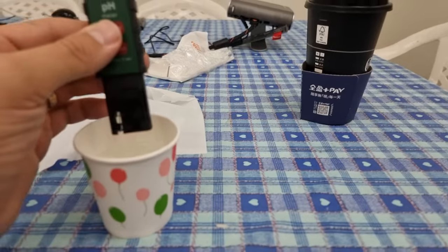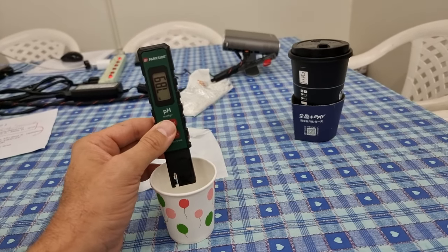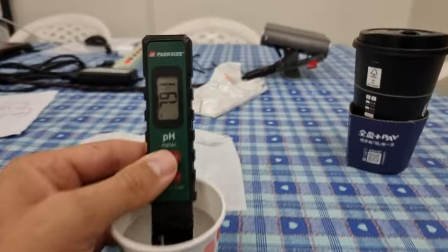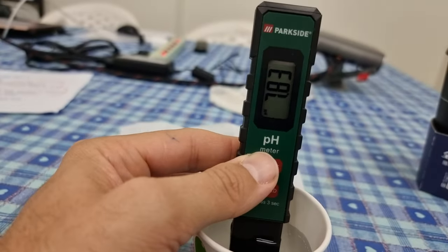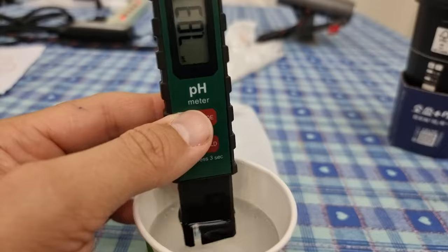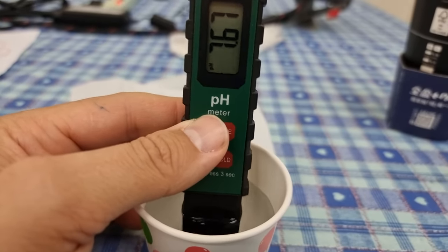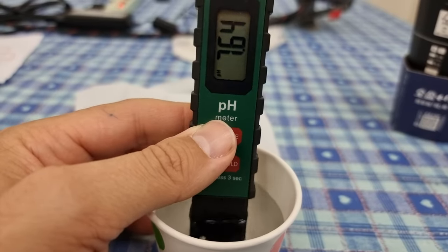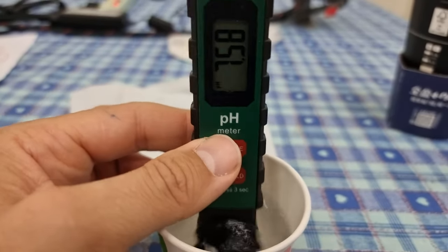I'm going to test some tap water here. Is it tap water that you use for producing your reverse osmosis? Yeah. So this is the kind of starting water here. You have to wiggle it around because it's got to get rid of the other reading. Normally you should wash it in de-ionized water, but anyway.